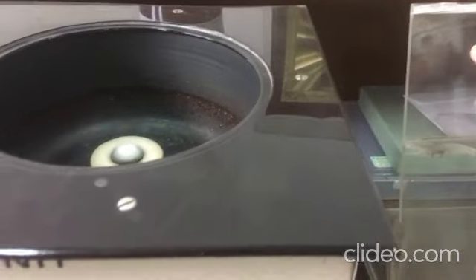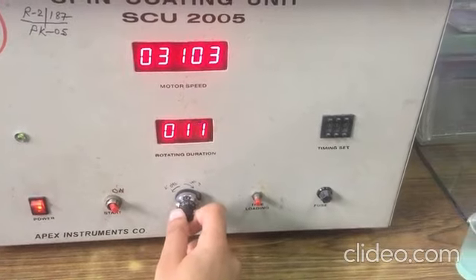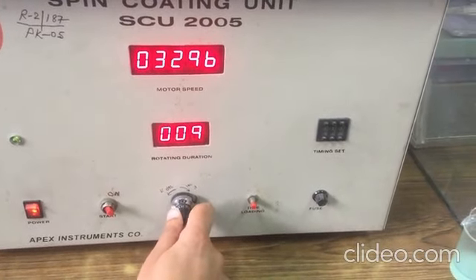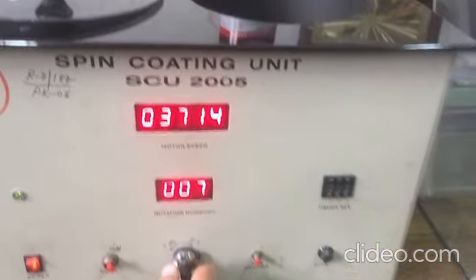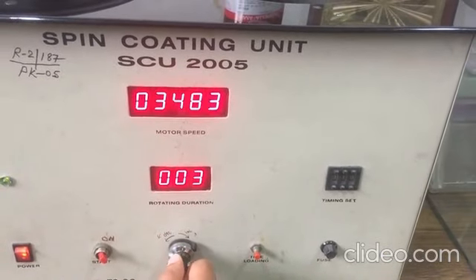In between, you can change the speed of the rotor with this knob. In clockwise direction you can increase the motor speed. In counterclockwise direction you can decrease the motor speed.